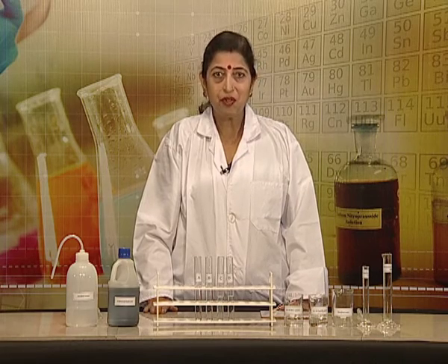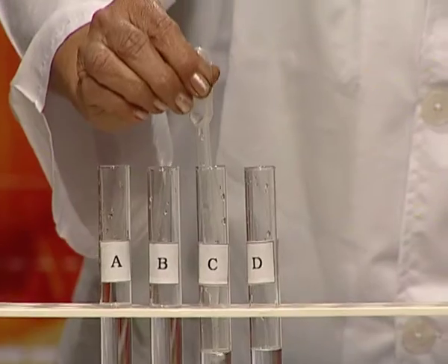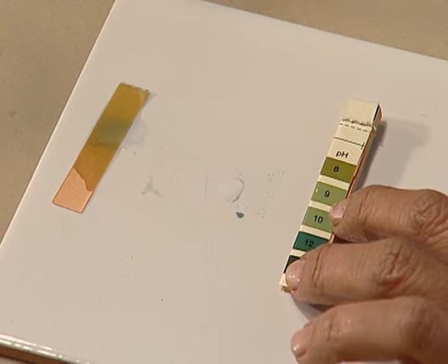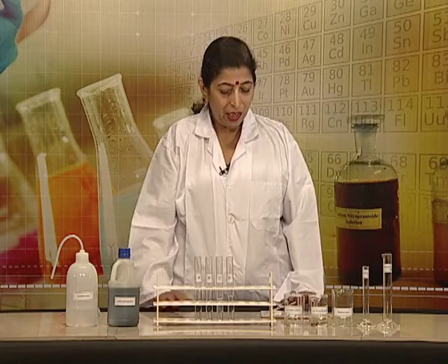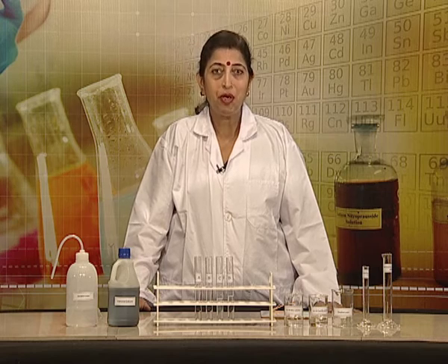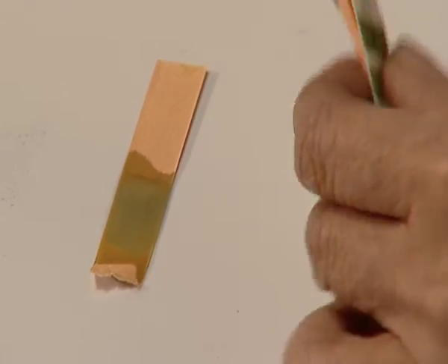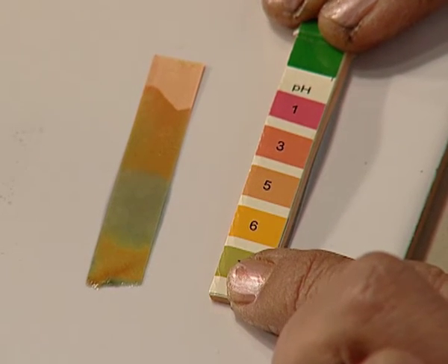We repeat the same procedure with solution C. Pouring one drop of solution C on pH paper strip. The color matches with pH value 9. Now we will see the pH value of the last sodium hydroxide solution, which is solution D. With solution D, the pH value comes out close to 7.